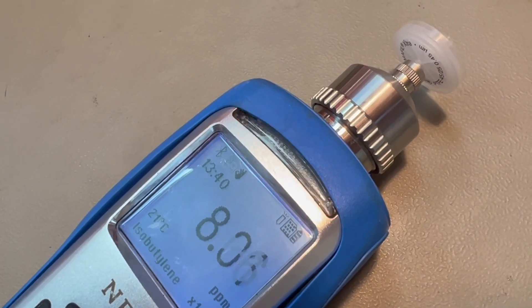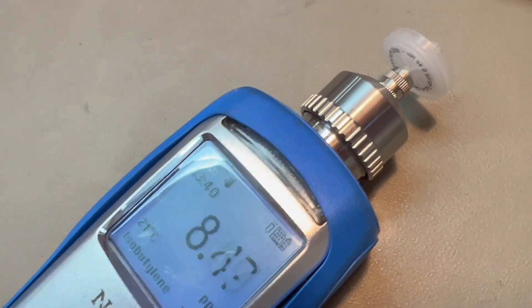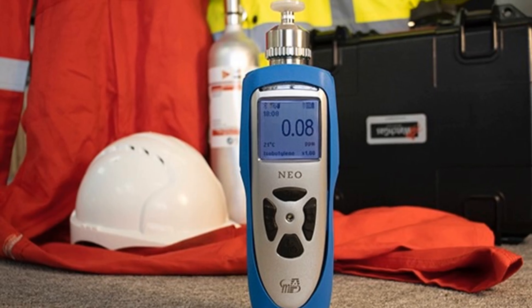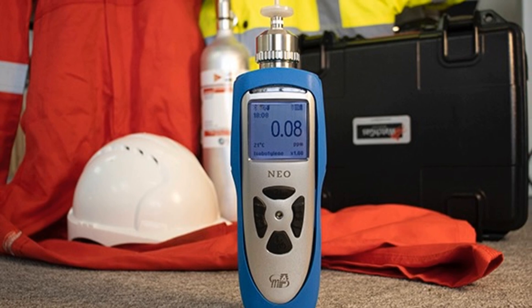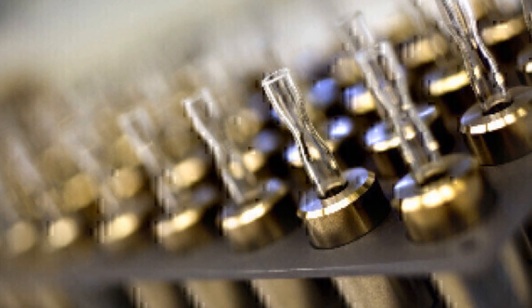We use the photoionisation detector, or PID. This tool provides real-time data on VOCs in the air. Understanding how a PID works is crucial for effective VOC detection.